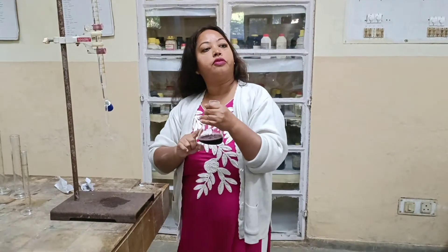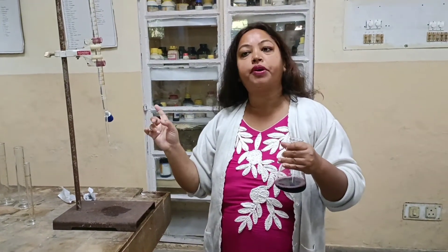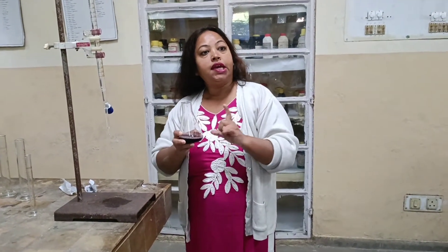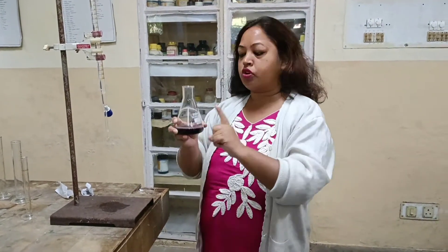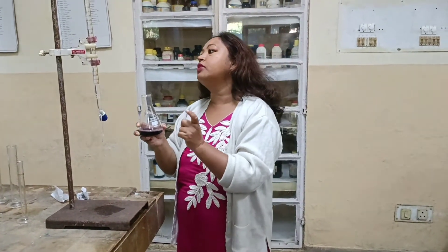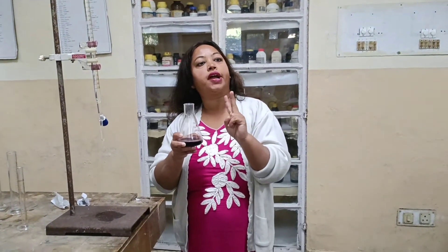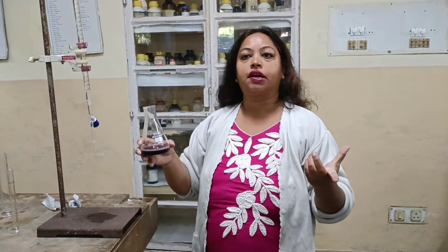One very important question asked about this titration is why we are adding buffer. The buffer is your ammonia buffer, made up from an ammonia and ammonium chloride mixture. We are adding this buffer for two reasons. First is for the stability of the dye-metal complex. The second reason for adding the buffer is to give you the perfect colour. So two reasons: stability of this complex and for giving the proper colour.